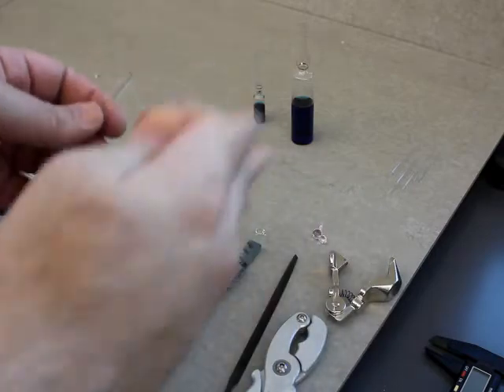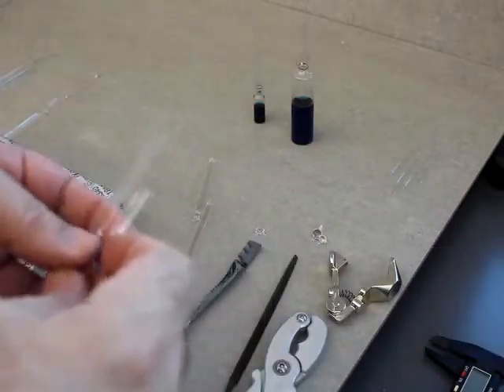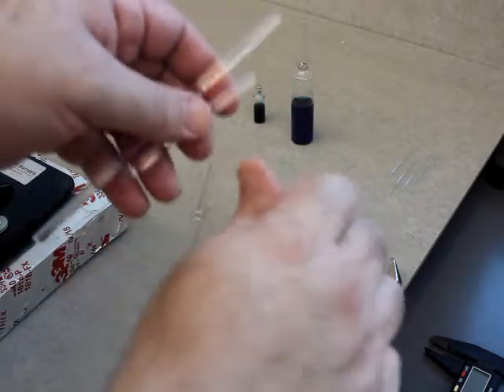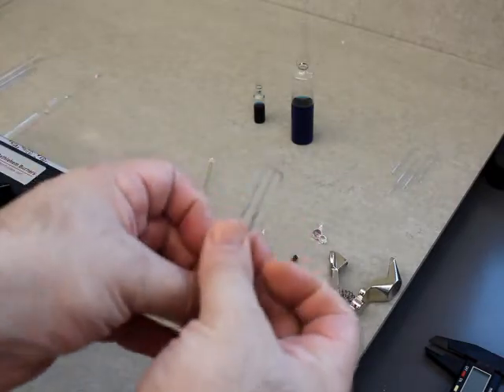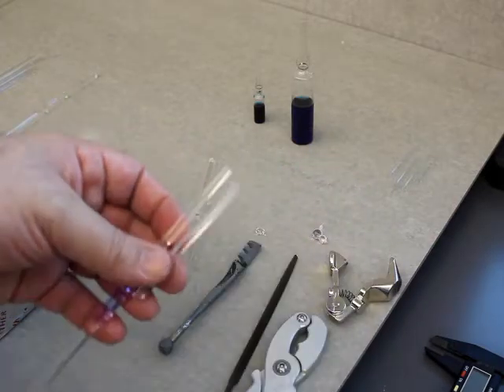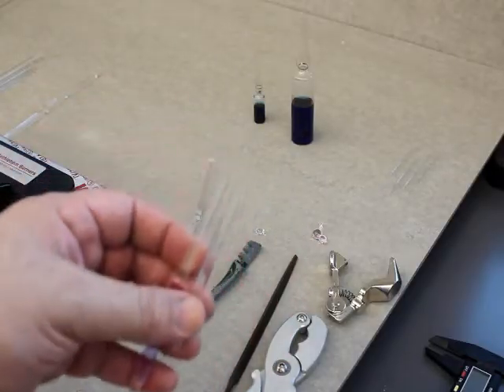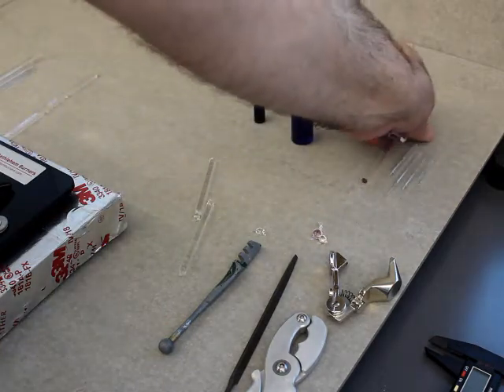That way you don't forget something and make a mistake and cut yourself. If you're following all of these steps very methodically and doing it the same way over and over again, you get yourself to the point where you can break the glass cleanly — very clean edges. Sometimes you'll end up with little shards of glass sticking out, typically because you didn't have a good score. But this method of cutting glass is very important in the chemistry lab.